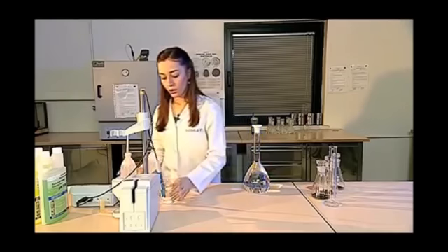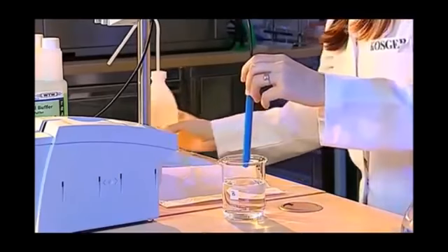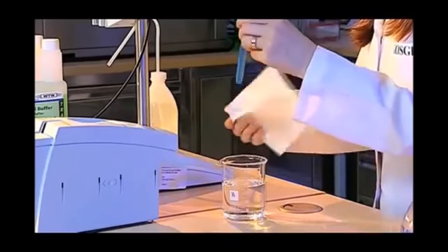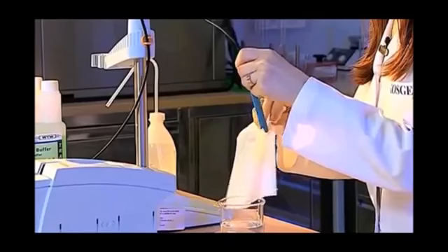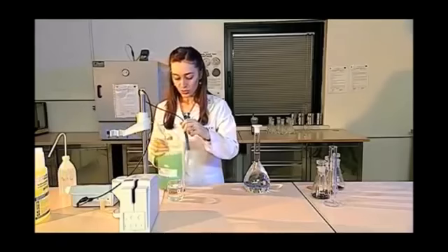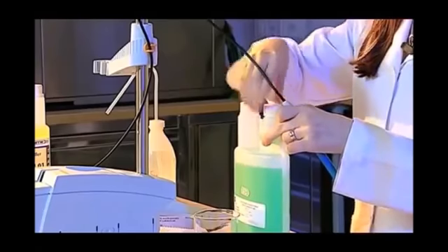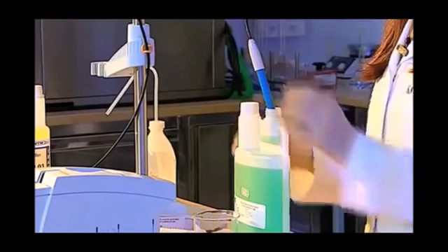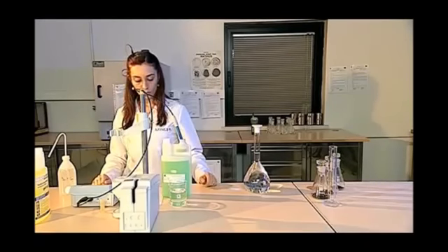I adjust the calibration of the pH meter to measure the pH of the potassium chloride solution that we have prepared. Therefore, we wash the tip of the electrode with distilled water first. Then, we slowly dry it with the edge of a napkin, and we especially make sure that everywhere is dry. We use pH 7 and pH 4 buffers for the calibration process. We start the measurement with the calibration step in the pH meter.